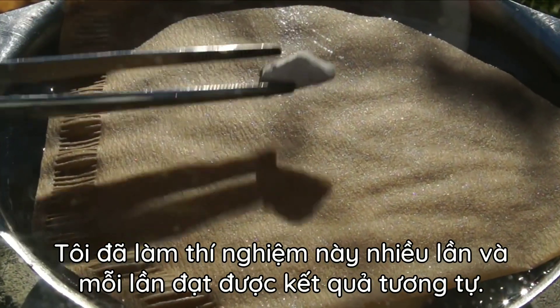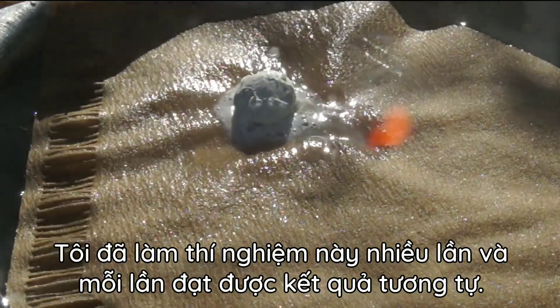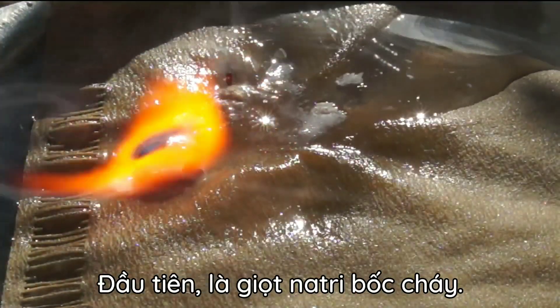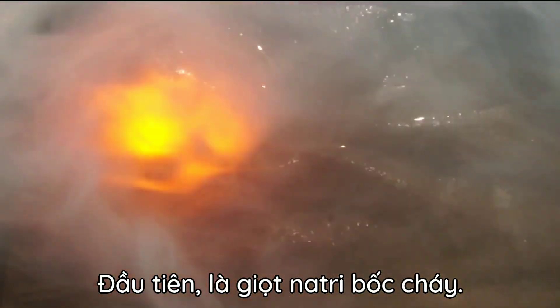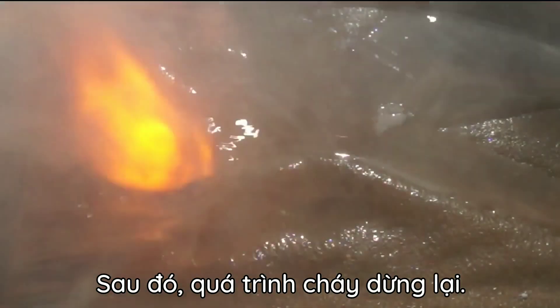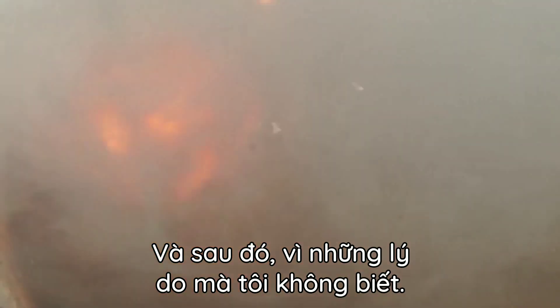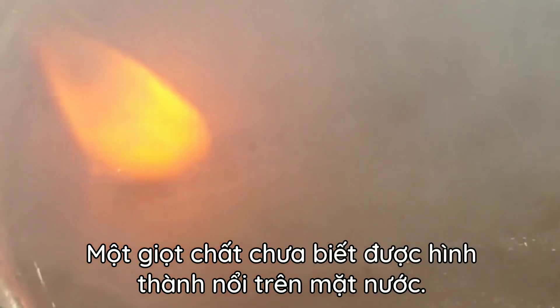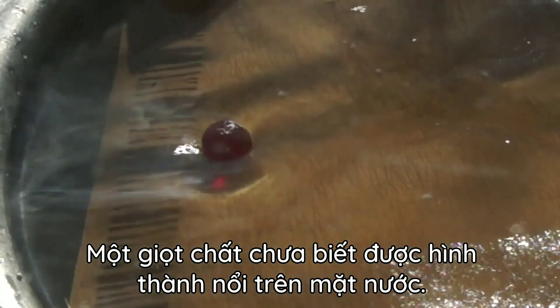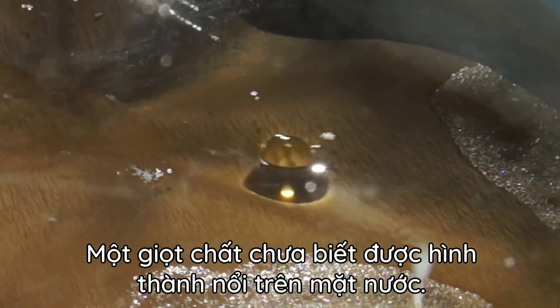I did this experiment several times, and every time the same result was achieved. First, the droplet of sodium ignites, then the burning stops. And then, for a reason unknown to me, a droplet of unknown substance is formed, which floats on the surface of the water.